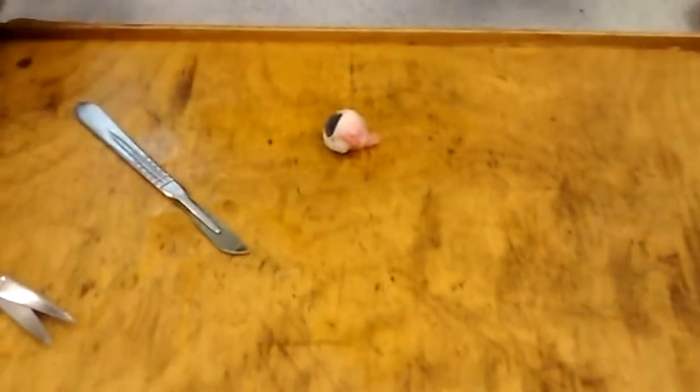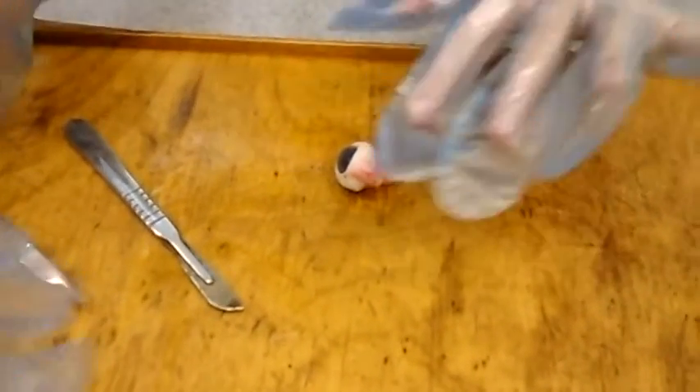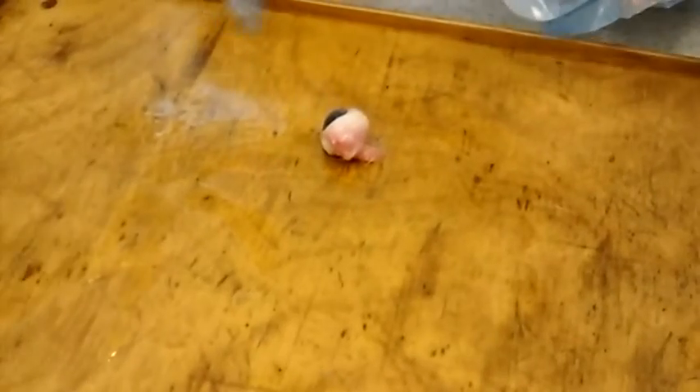This is at school — we're doing a science project and we're dissecting an eyeball. Can someone pass me up the scalpel? Oh my god! Okay, this is the scalpel.